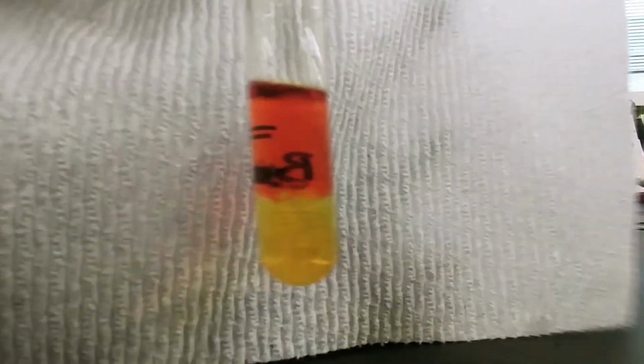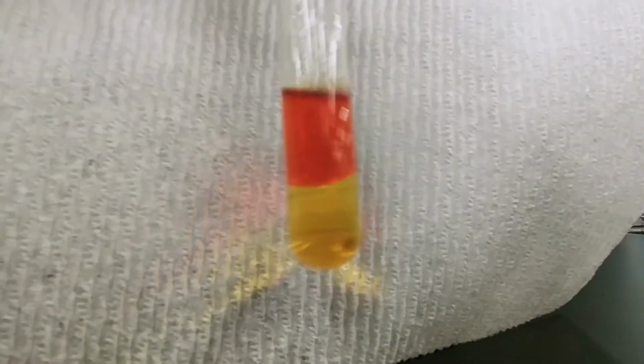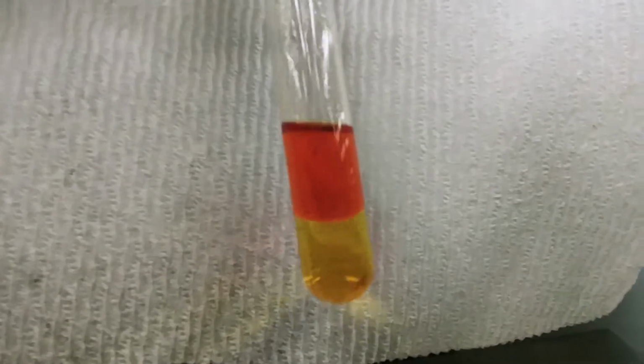Again, I'm going to erase the markings on here to make it a little bit easier to see the colors, so that you can see that there is indeed a very big difference once the bromine goes into the cyclohexane. Initially, the cyclohexane is clear, colorless, and floating on top of the aqueous layer, and then once it absorbs a halogen, it will take on a specific color to that halogen. One last time, here is the bromine in cyclohexane. Again, the cyclohexane is the top layer. We know it's only bromine in here because only bromine was present in that aqueous layer.